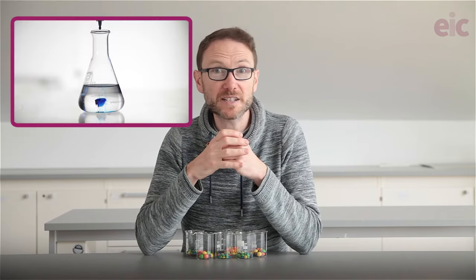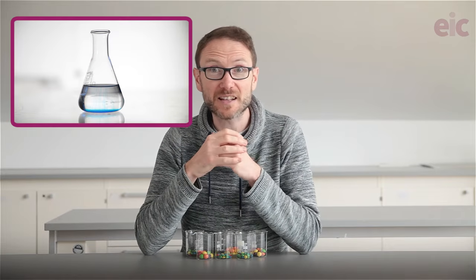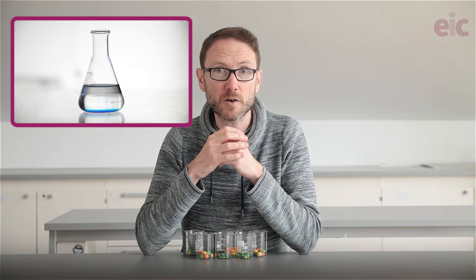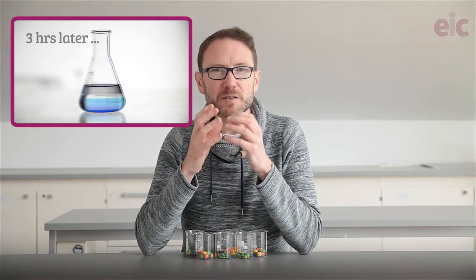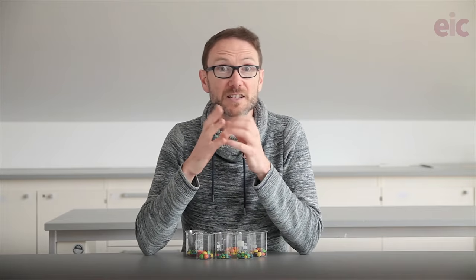A typical start to a sequence of lessons on the particle model might incorporate demonstrations to show diffusion, highlighting that at the smallest scale particles are always on the move. But diffusion in liquids can be frustratingly slow. Today we'll look at a simple experiment with surprising results that can let students see liquids moving in real time without stirring.